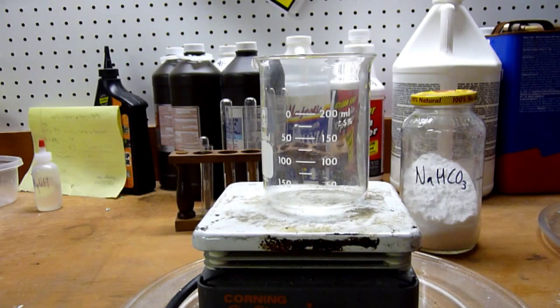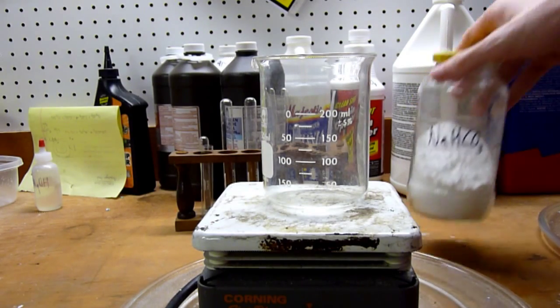So, the reaction tends to be a lot easier to perform since there's no foaming over of the final product. And this foaming usually takes the addition of the two solutions and makes them take several minutes.